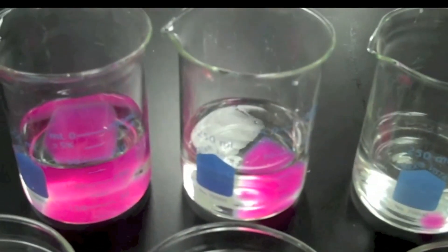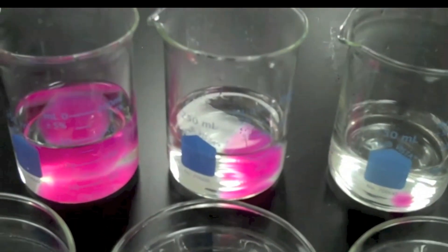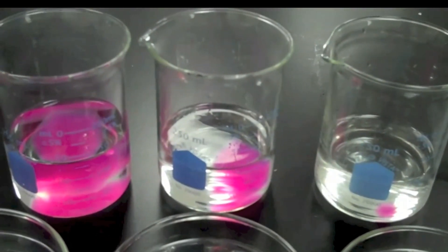Let's see how this rate of diffusion varies. Raw materials must be able to reach all parts of a cell's volume quickly. Notice how the acid is diffusing into each cube at the same rate, but that in a given time period it is reaching a greater proportion of the volume in the smaller cube as opposed to the bigger cube.